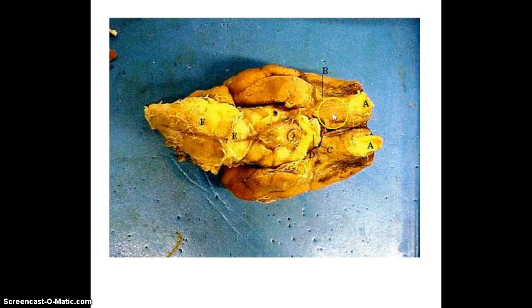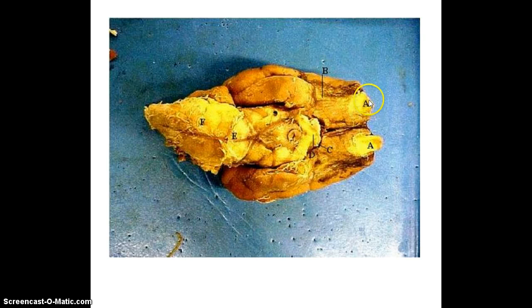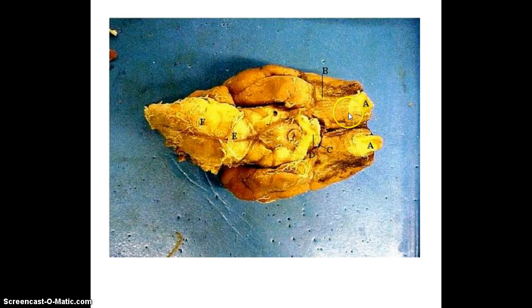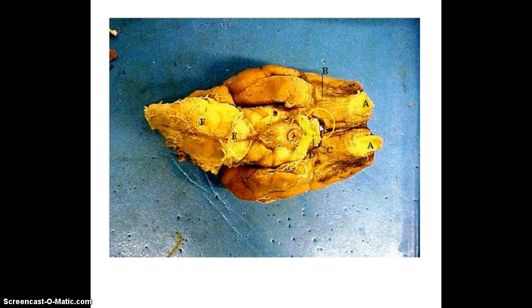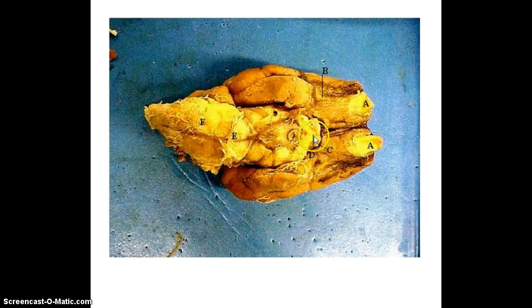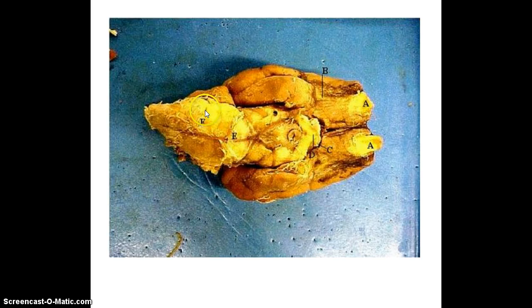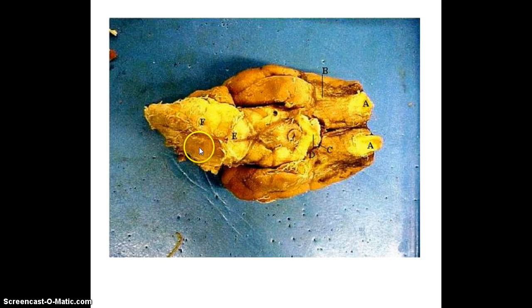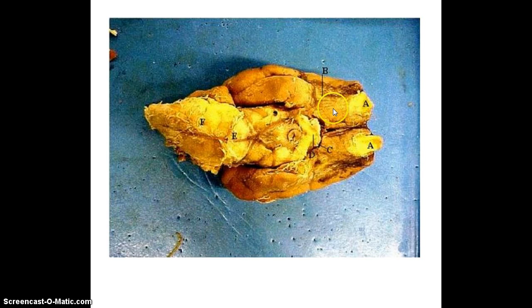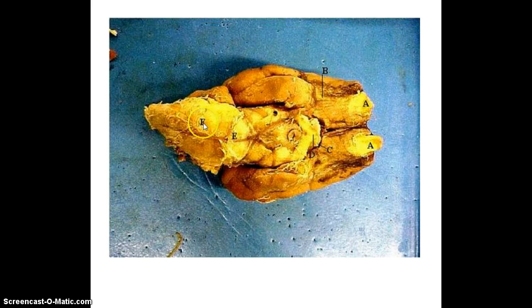Looking at the inferior view, the whole thing here is your olfactory nerve. You have the olfactory bulb, olfactory tract, and again the whole thing is the olfactory nerve. Here you see the little stubs of where the optic nerve was cut. Remember, where they cross over is the optic chiasm. Here are the mammillary bodies. This is the pons. To recap: olfactory nerve, olfactory bulb, olfactory tract, optic nerve, optic chiasm, mammillary bodies, and pons.